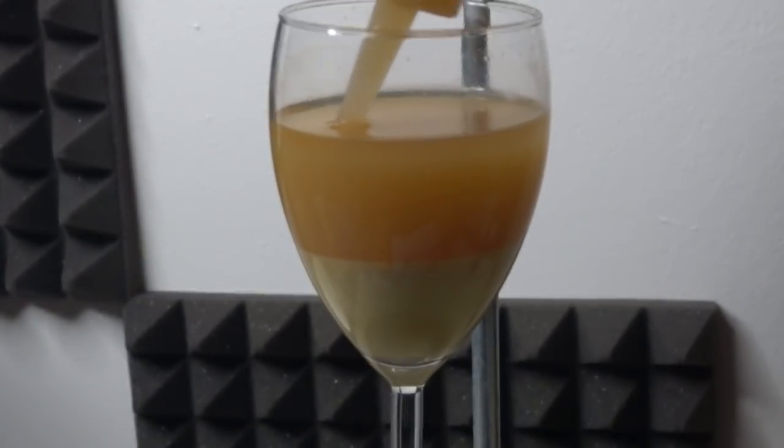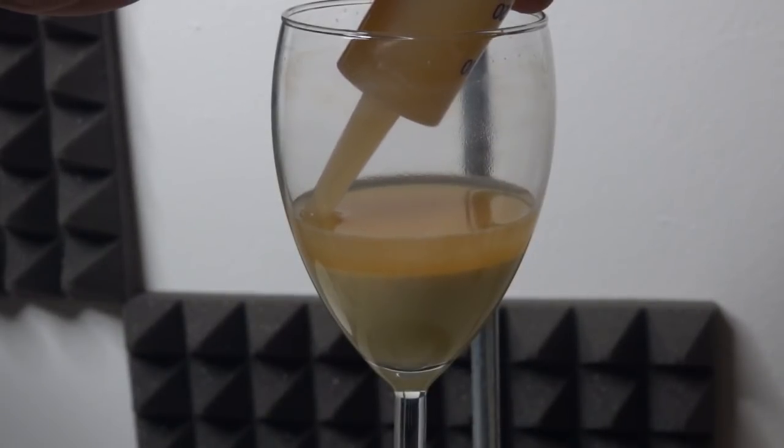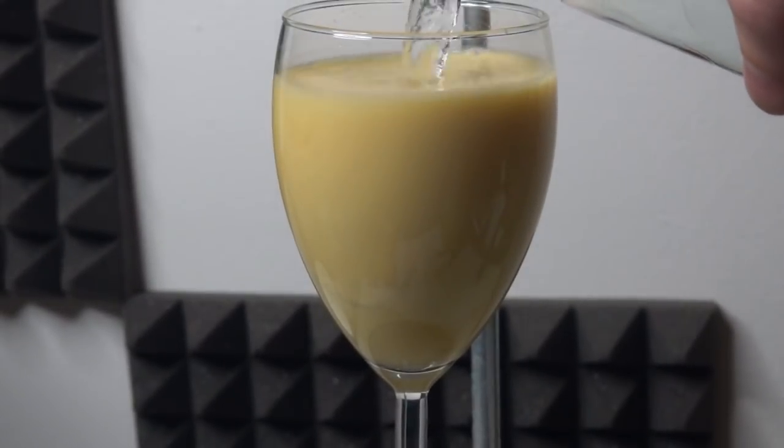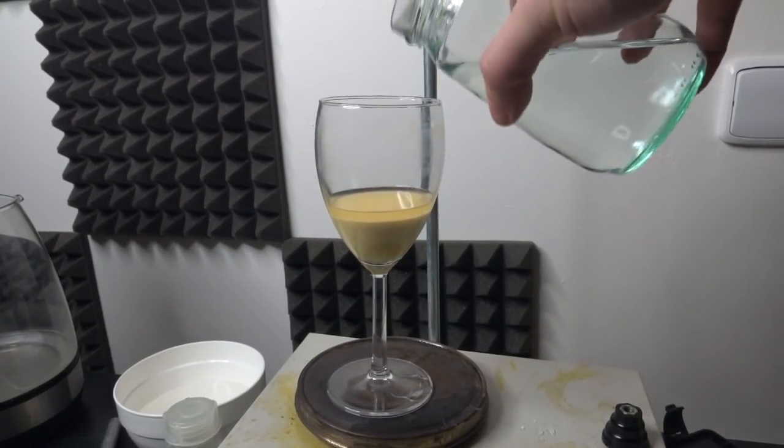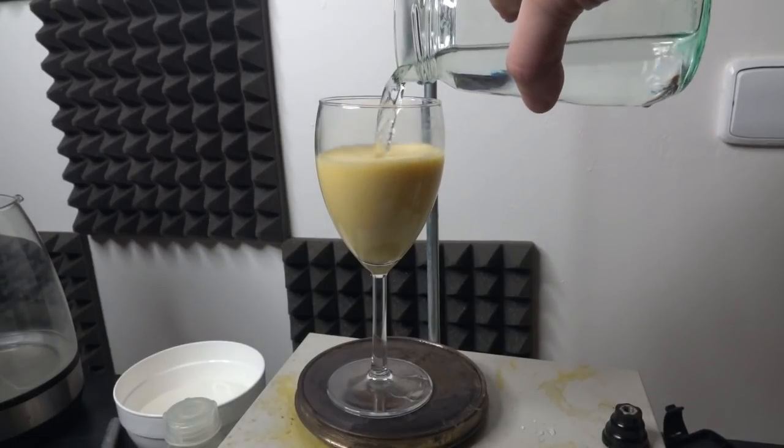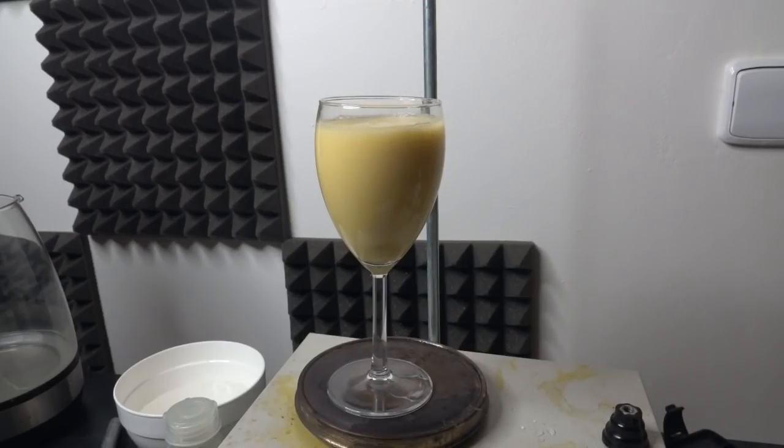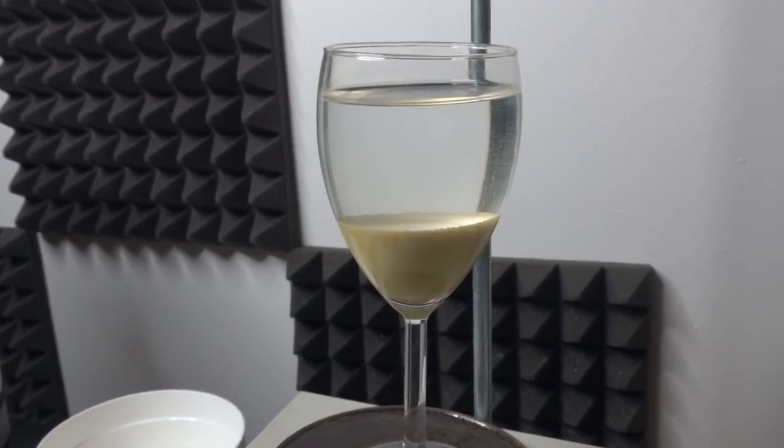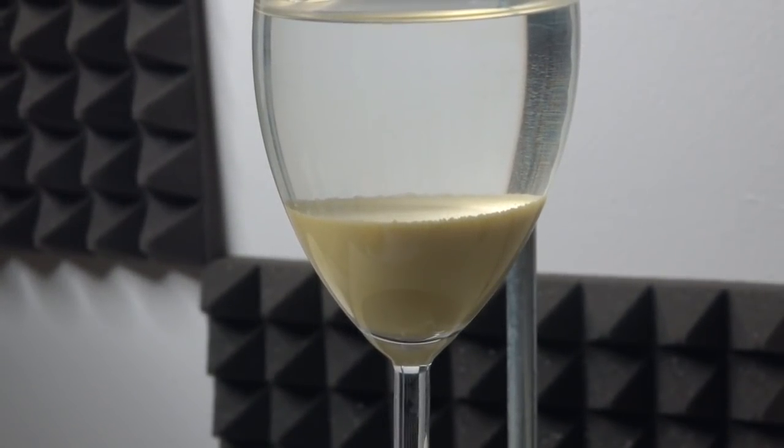Let's wash it again. Washing number two and I think we got about 70% of the crap off with that washing. And with that I think we're done. So I left it to stand overnight. Now all I'm going to do is get that out and dry it out and see how much I've got.